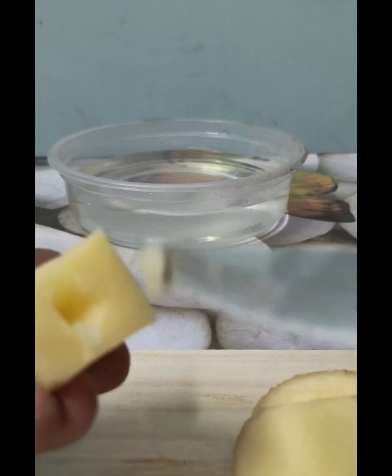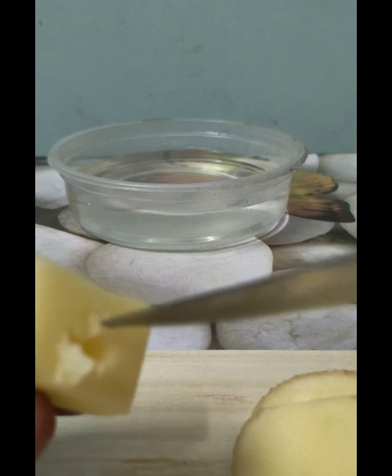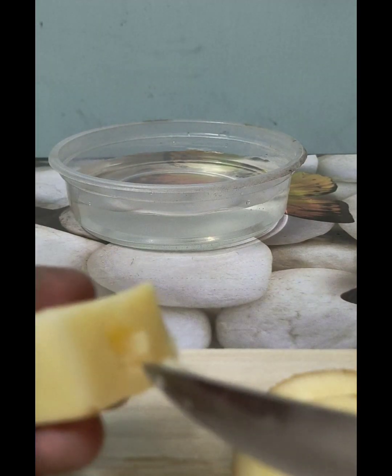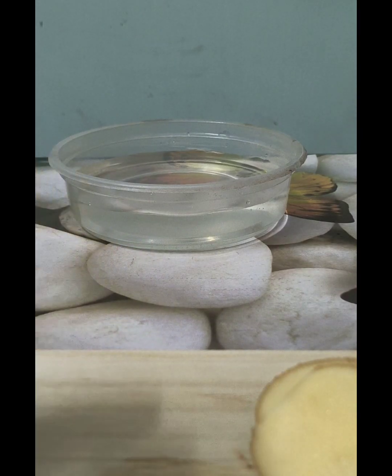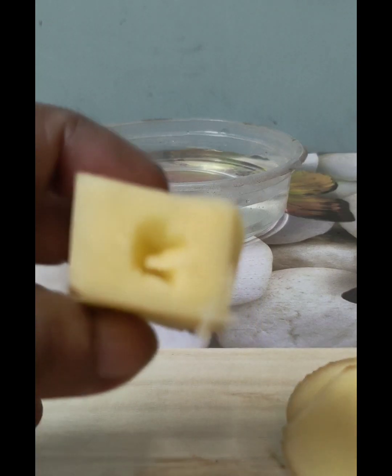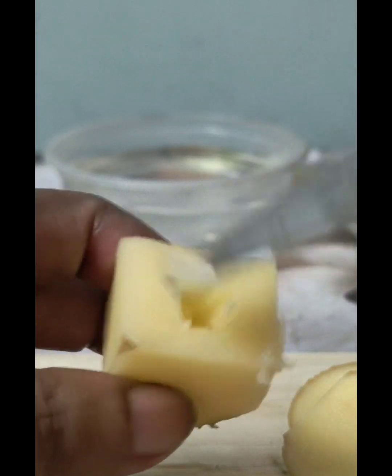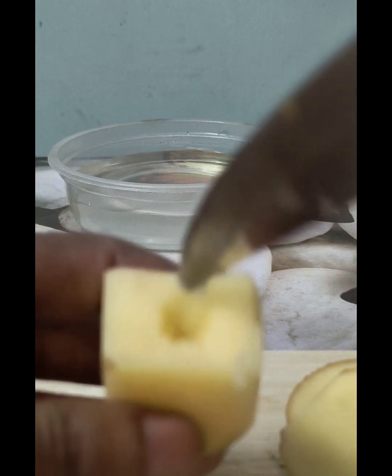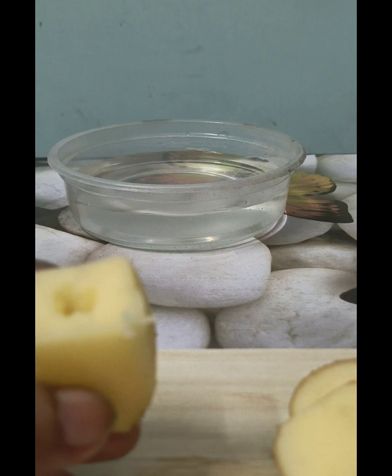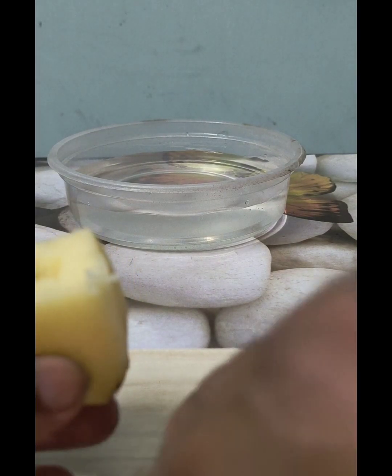But why pour concentrated solution? Because the cell sap in a plant generally contains concentrated solution because of the photosynthesis that it performs. Let me fast forward this by making a proper hollowness inside this potato cube so that I can pour some concentrated solution, which will actually resemble the condition of the cell sap inside a root hair cell.